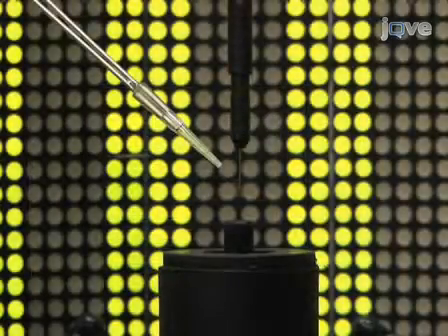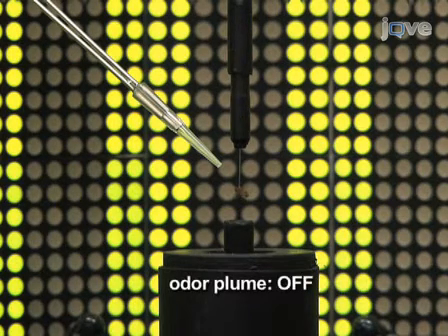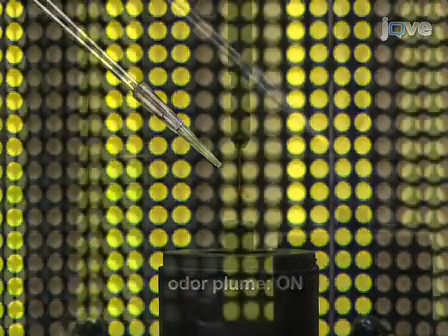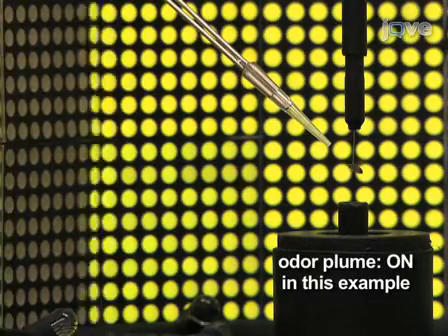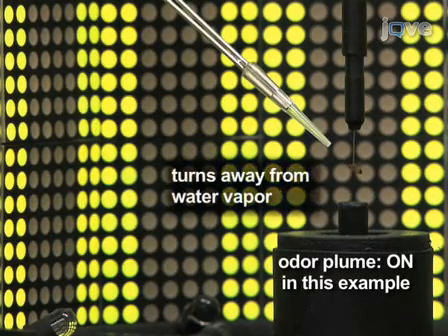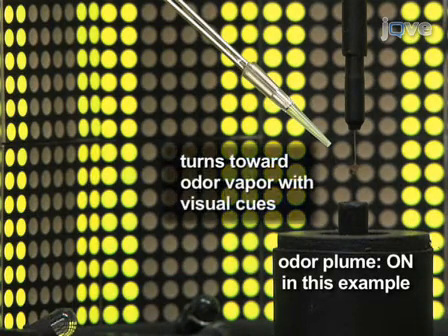When challenging a fly to find an odor plume on its own, it should never localize a water vapor plume to a significant degree, but it should always localize an odor plume in the presence of rich panoramic visual cues. A second test is to visually drag a fly directly into an odor plume and challenge it to maintain its heading within the plume against a variety of stationary visual backgrounds. If the fly is dragged into a water vapor plume, it should quickly turn away. If the fly is dragged into an odor plume, and there are sufficient visual cues to mediate robust tracking, the fly will stay in the plume.